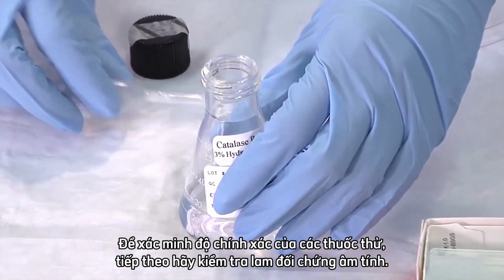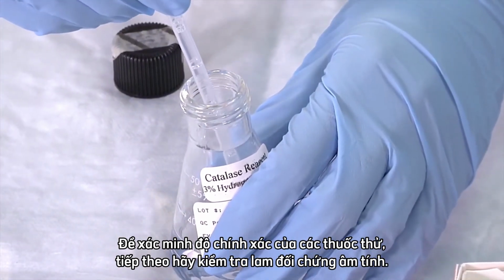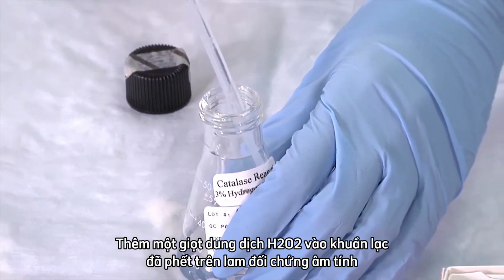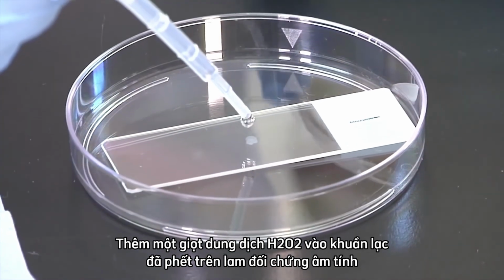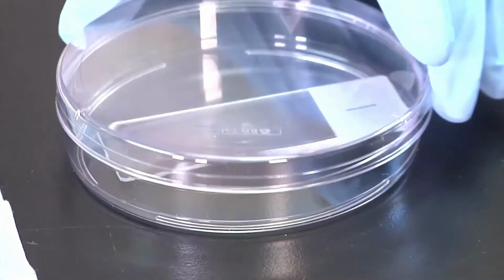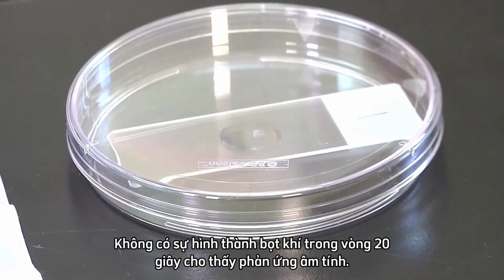To verify the accuracy of your reagents, next test the negative control slide. Add 1 drop of H₂O₂ solution to the smeared colony on the negative control slide and close the petri dish. No formation of bubbles within 20 seconds indicates a negative reaction.